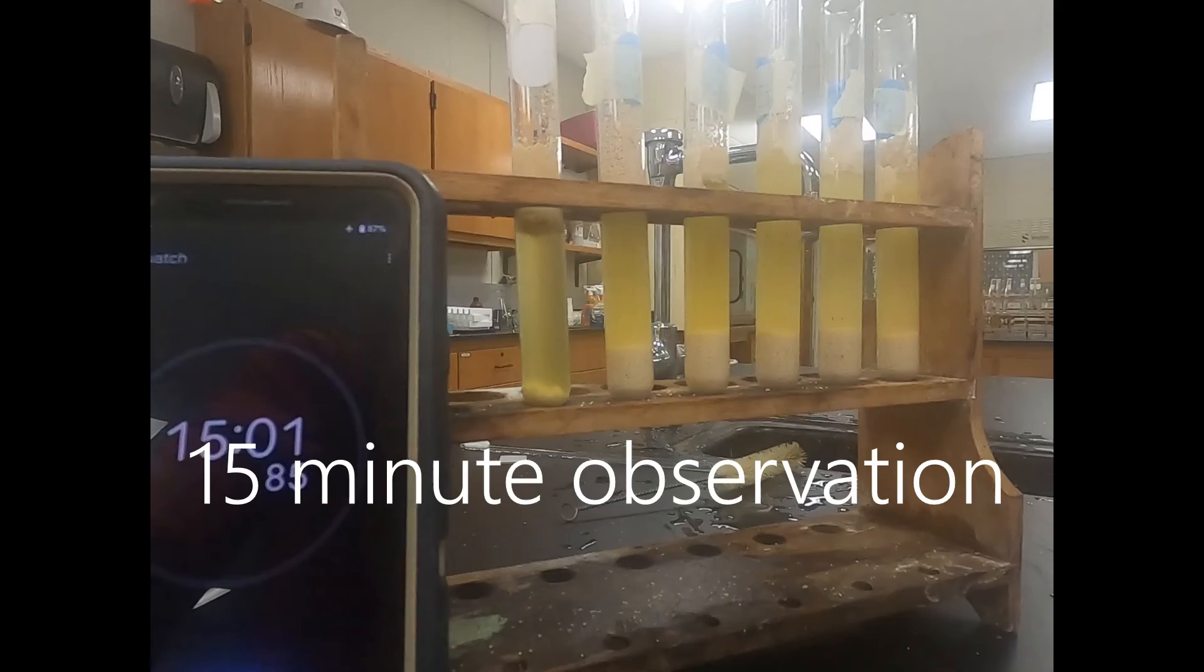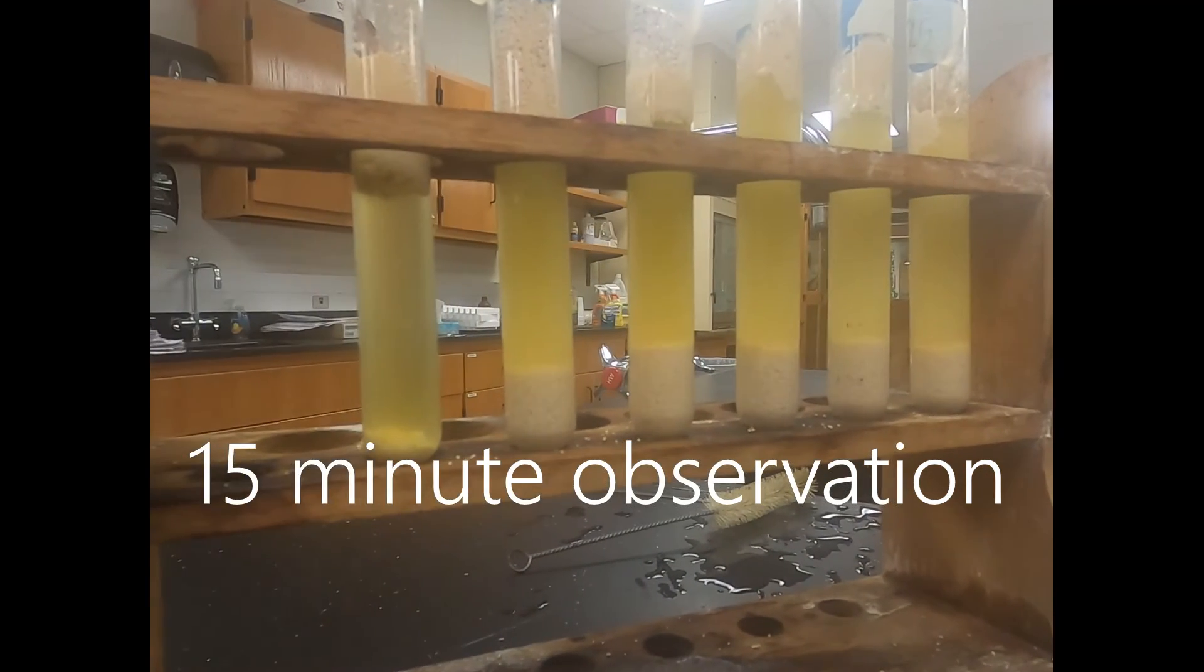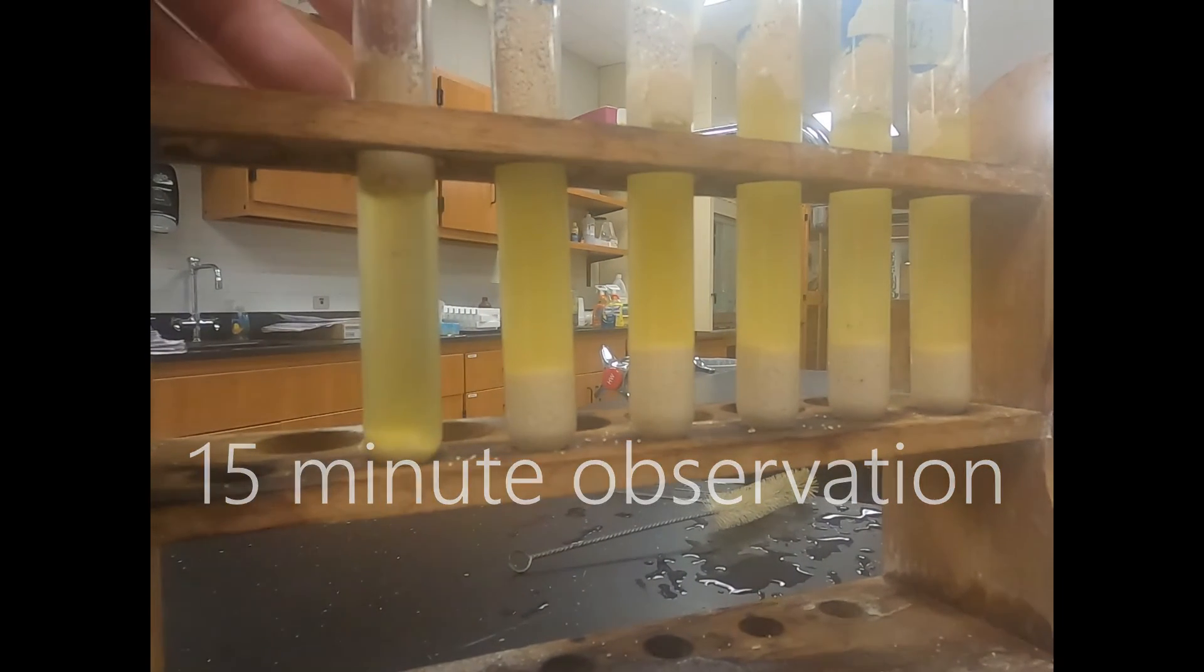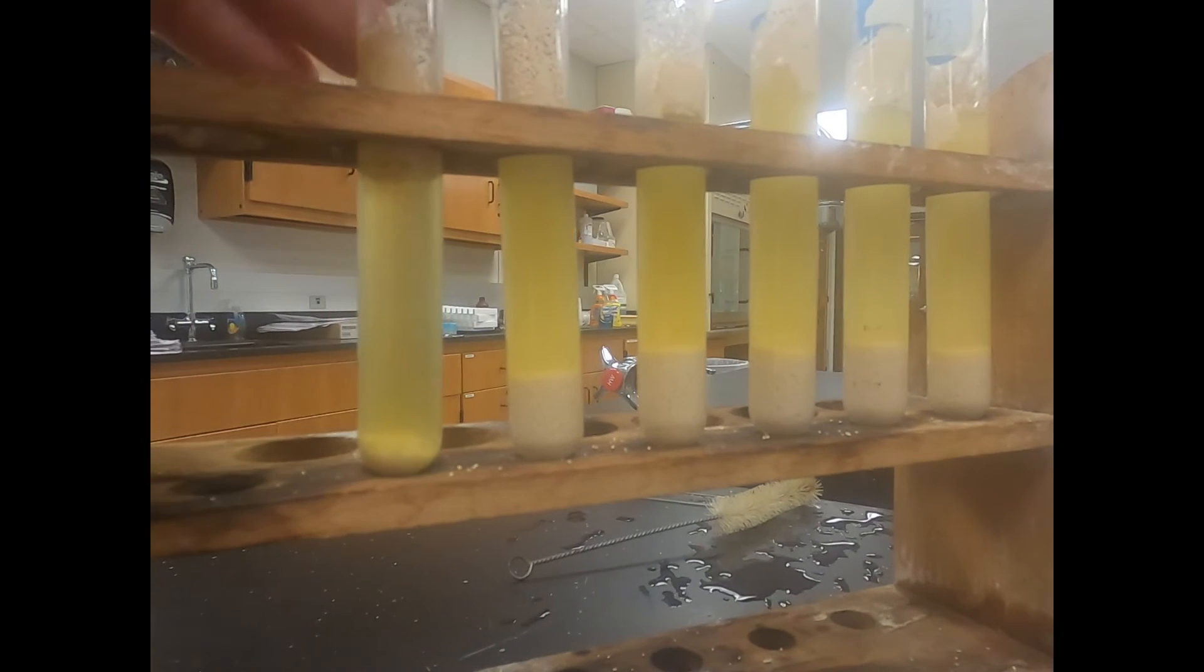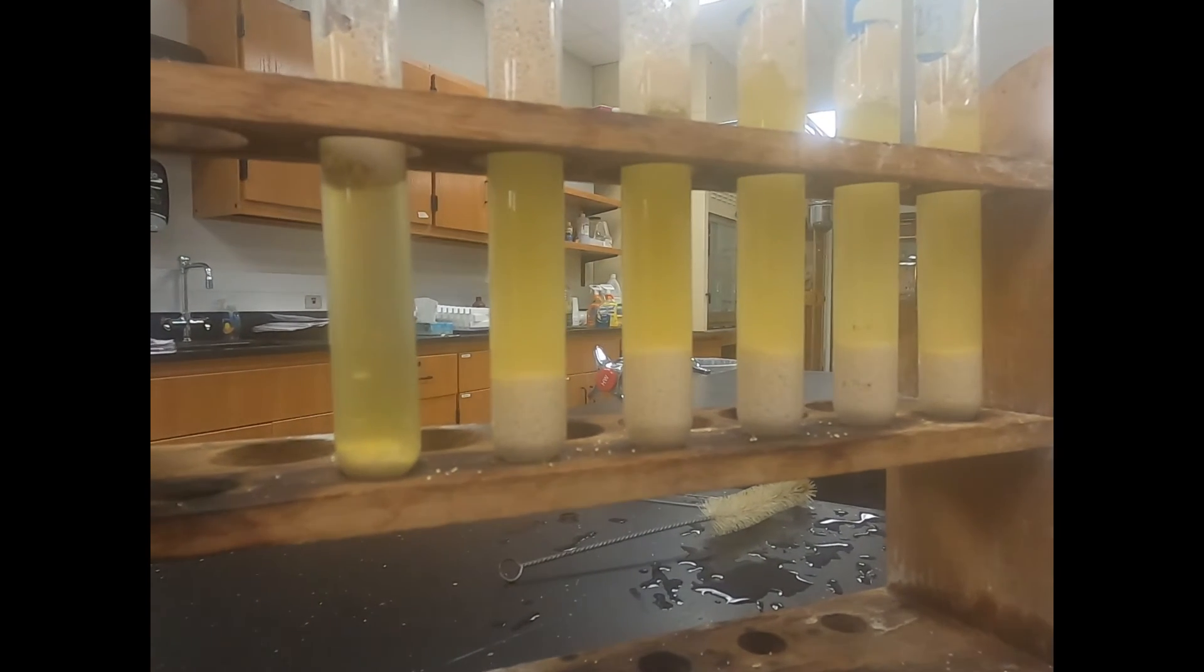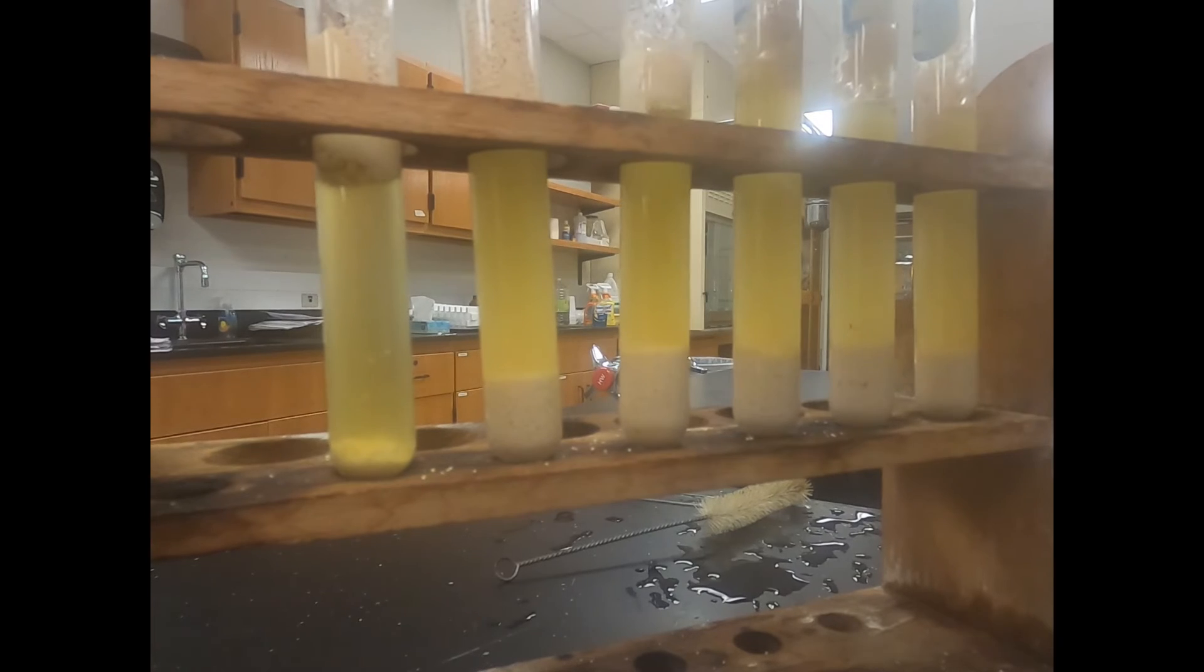Now we're at fifteen minutes. Time for our final observation. We start with zero drops on the left. It still has that green coloration to it. As we look across you can see that they've turned yellow.